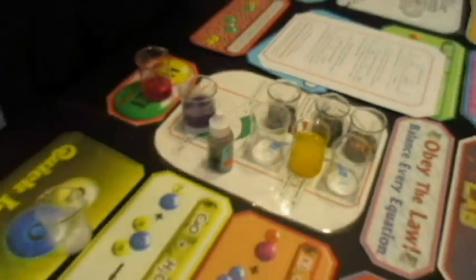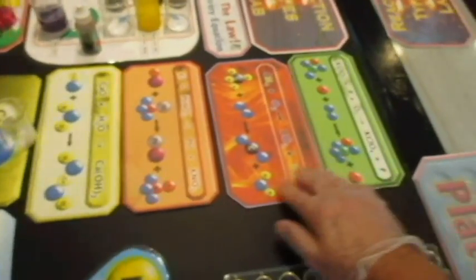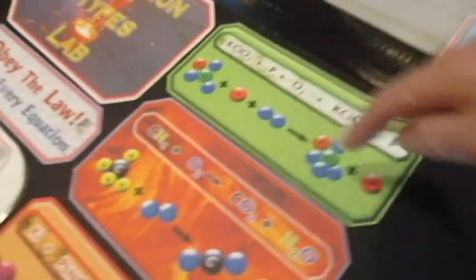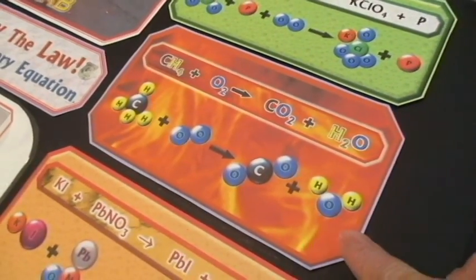That's funny. Okay, so by the way, there's a few reactions here that we did not just do. This one is part of that demo. This is lighting a match. This is the strip on a match. This is the safety match head. This is the reaction for the match. This is what happens on a stovetop or a Bunsen burner.